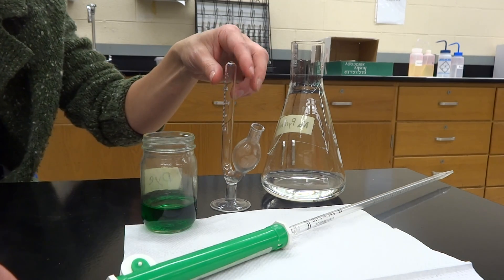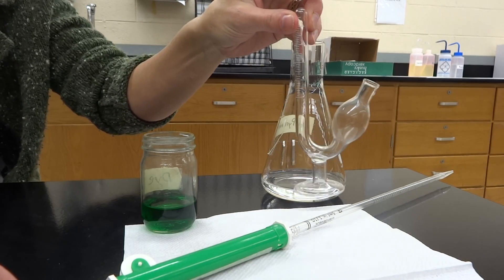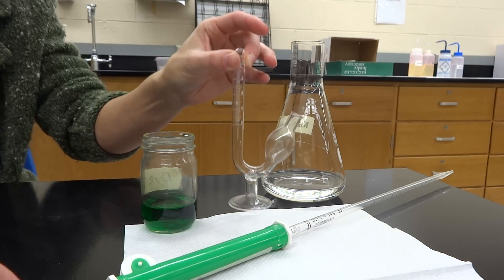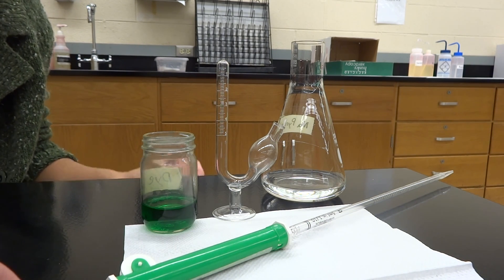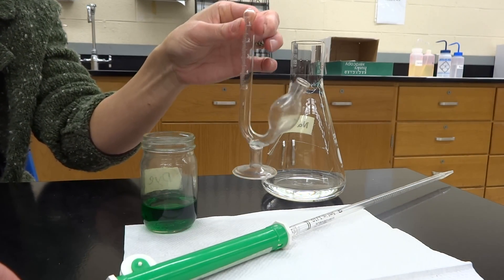Notice that the fermentation tubes are very interestingly shaped, and this does make them sometimes a little challenging to use and interesting to clean. They're breakable as well, so please be very careful with them — they aren't cheap either. When you do this experiment, you're going to have five different fermentation tubes. Please try to grab the same sized ones, because otherwise it gets all thrown off.